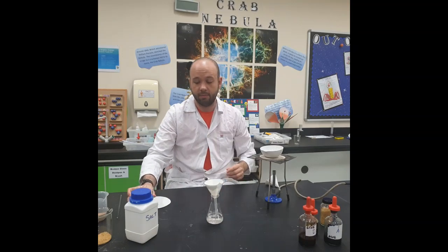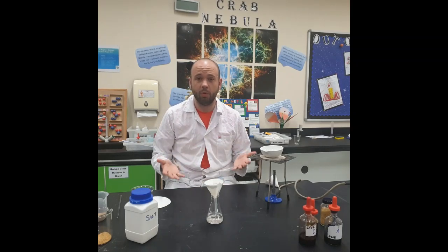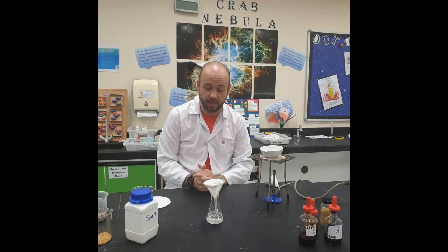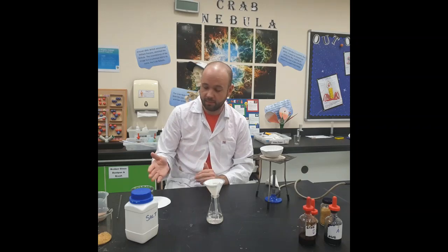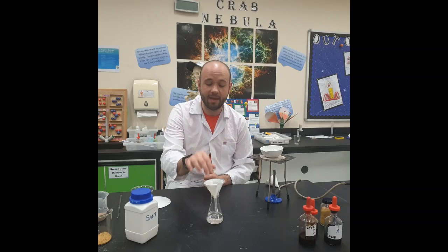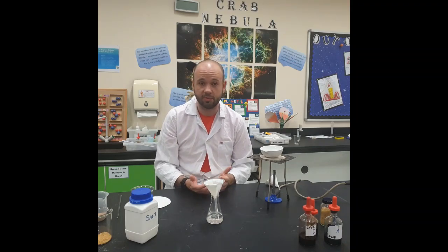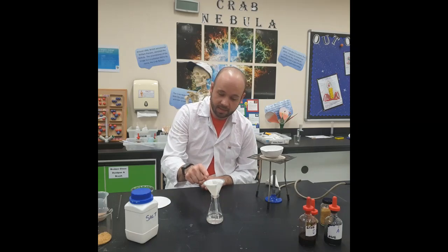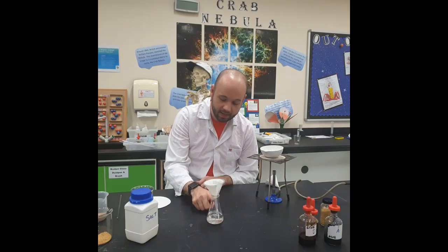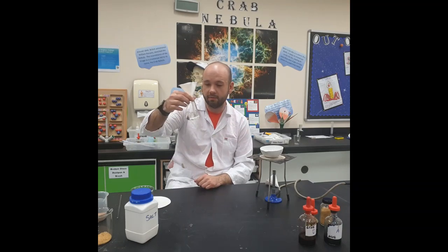Okay. Now, it'll take about 10 minutes to filter all of your mixture, and what will we be left with once it has all been filtered? So, as you can imagine, the sand is insoluble, therefore it will remain behind in the filter paper. Whatever's left behind in the filter paper we refer to as the residue. Okay? As you can see, most of the liquid is going through the funnel into our conical flask.